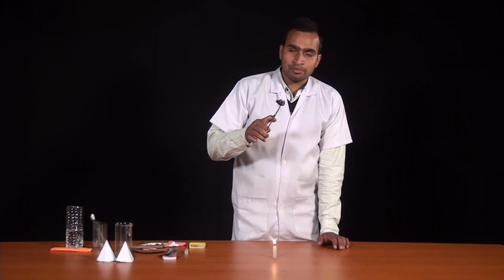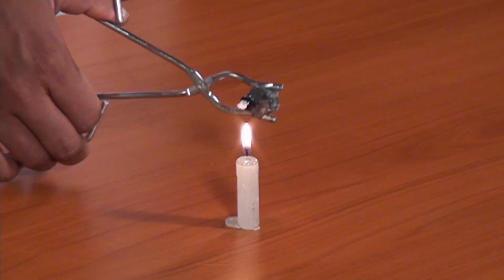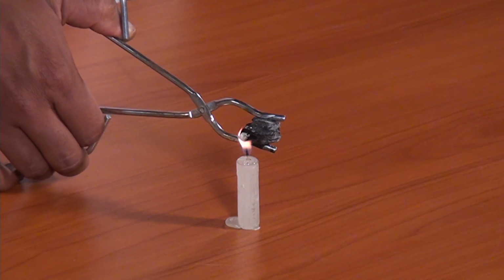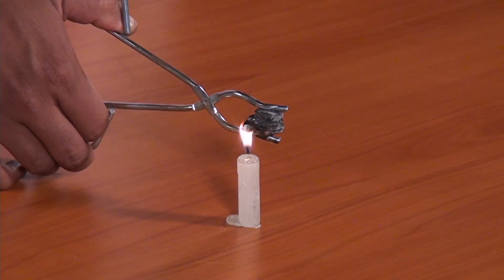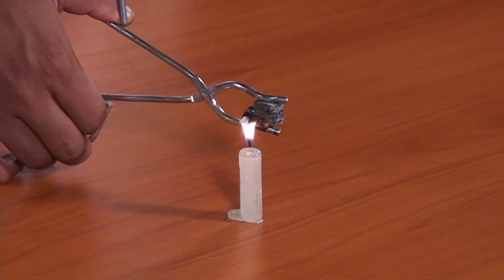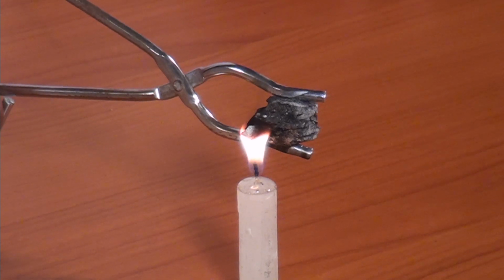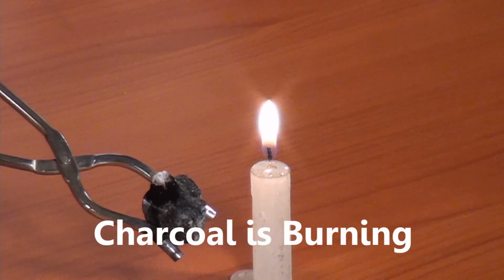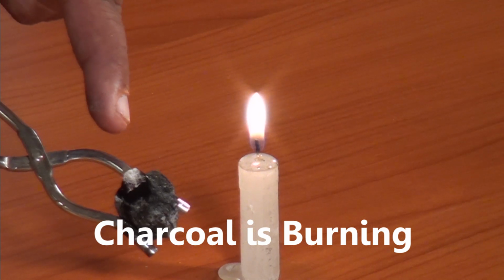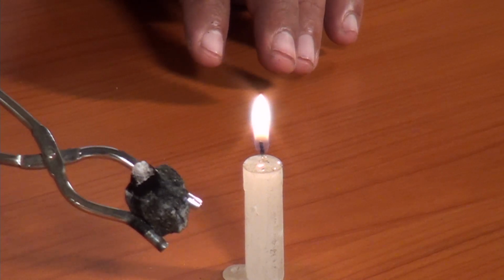You can see that this is a piece of charcoal. Let's try to burn this and see what's happening. We have put this charcoal on the fire and we can see that a flame is not observed here. As we observed in paper, this kind of flame is not observed. Now you see the tip of the charcoal. You can see some kind of white part. This is due to the burning of charcoal, but no flame is produced from the burning of charcoal.